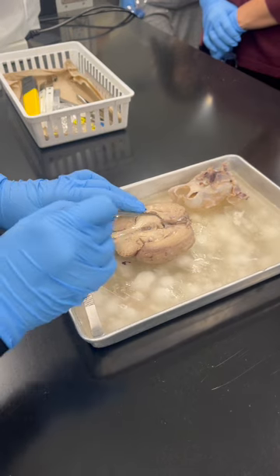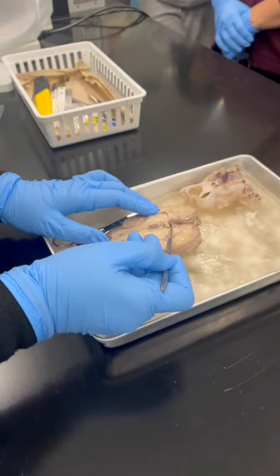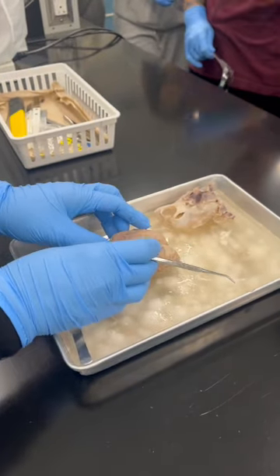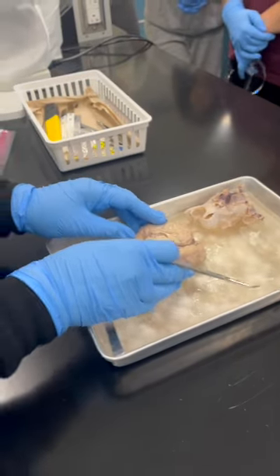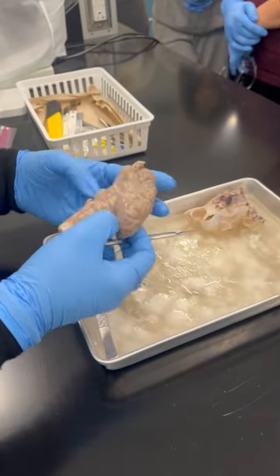Then what else? This gland over here is the pineal gland. See that small structure, the pineal gland. So this, no, hold on, I'm sorry. This one should be over here, what is it? Pituitary gland. Then if you see over here on this side, this is what?